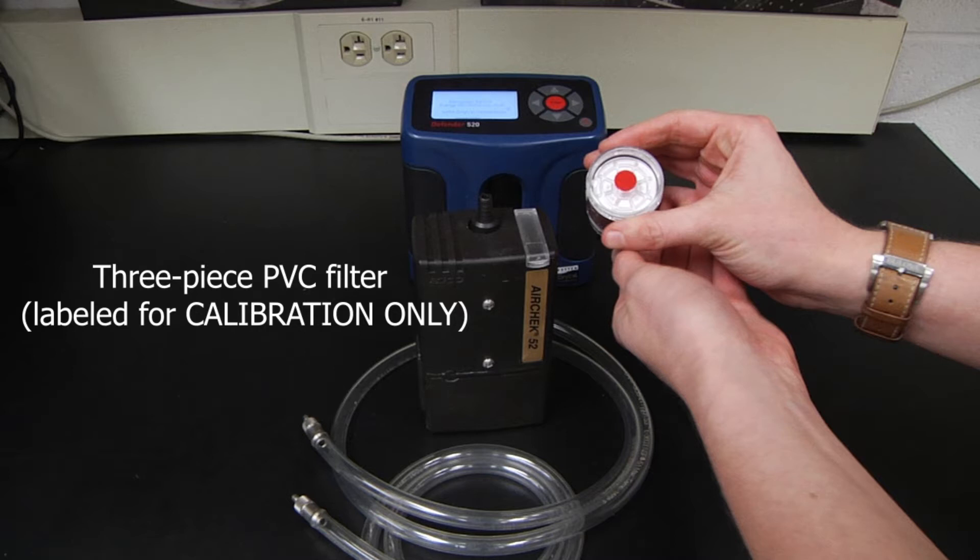Using the same cassette to calibrate that will be used for sampling may introduce contaminants into your sample, so it's important to have designated media to perform your calibration.